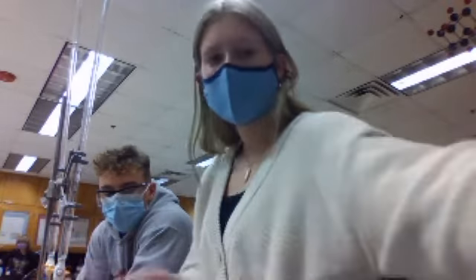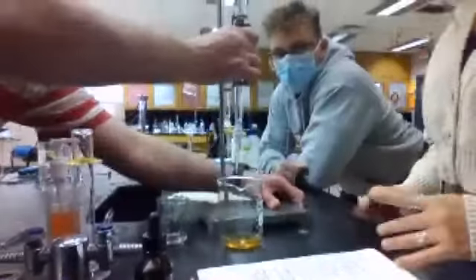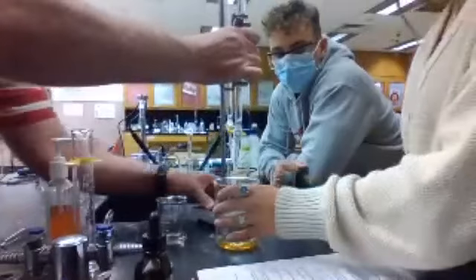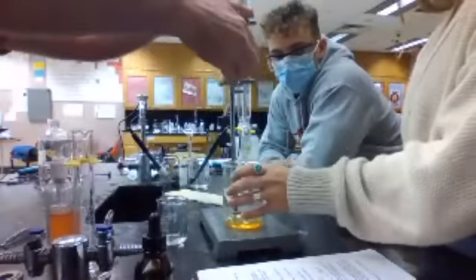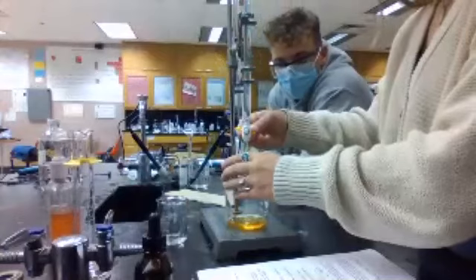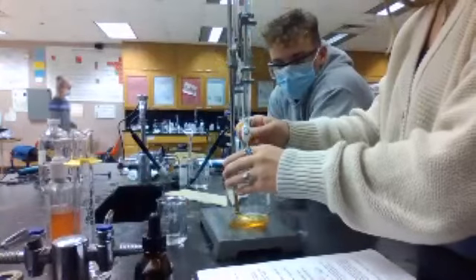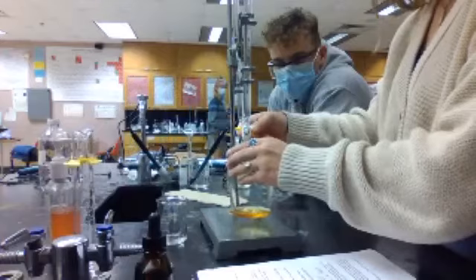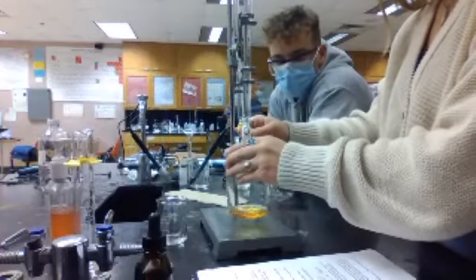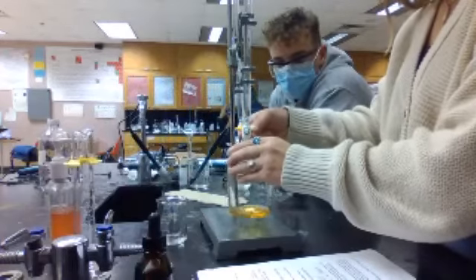Let me show you something a little bit better, because you're having a lot of trouble there. Let's do it this way. Now you should be able to swirl it and do it. I'm at 3, so once I get to 7, it should start, if their math is correct.